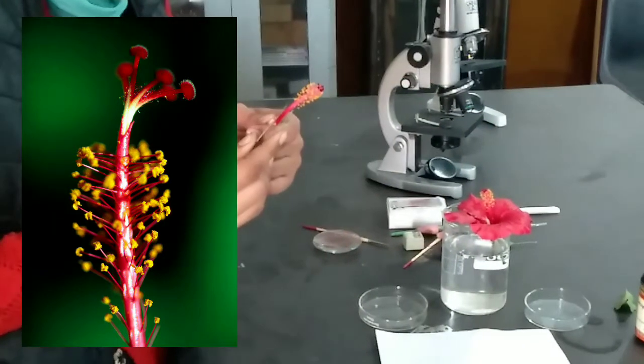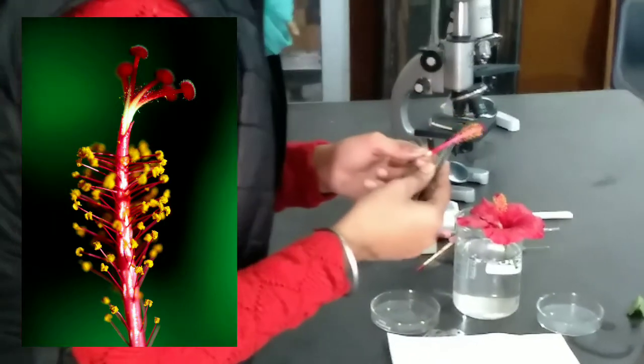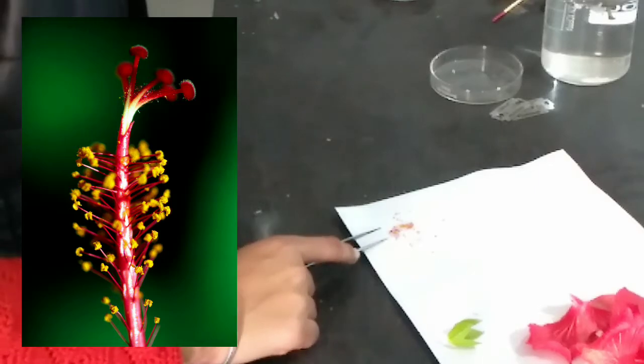These are numerous in number. These are stamens.